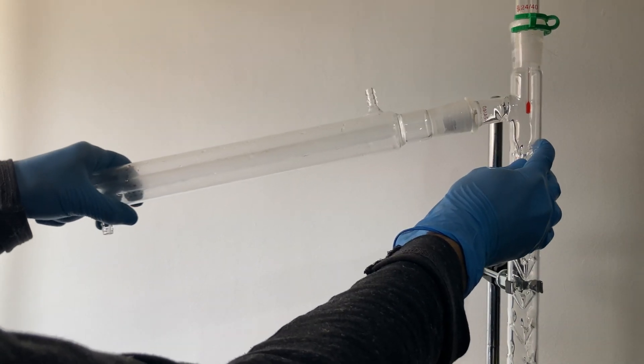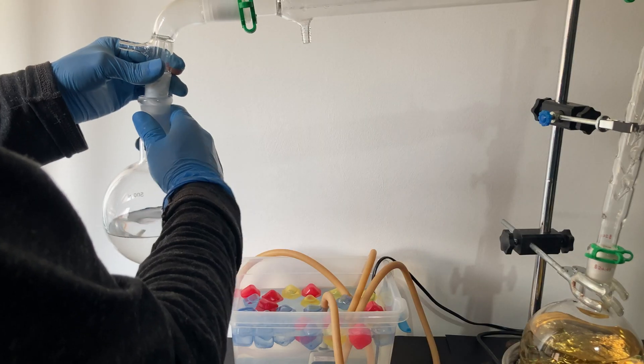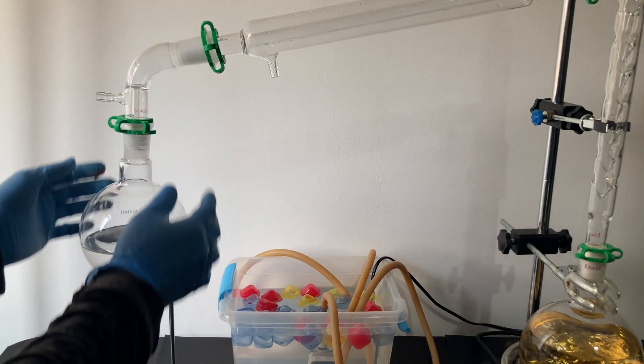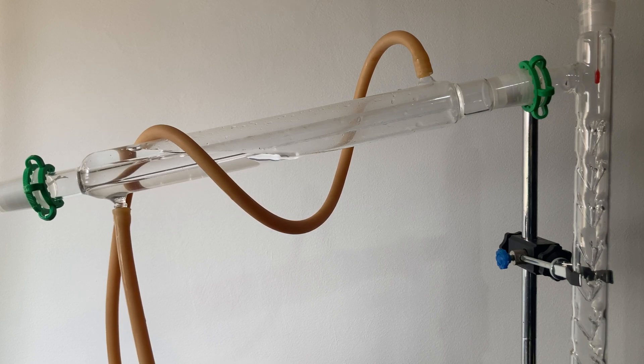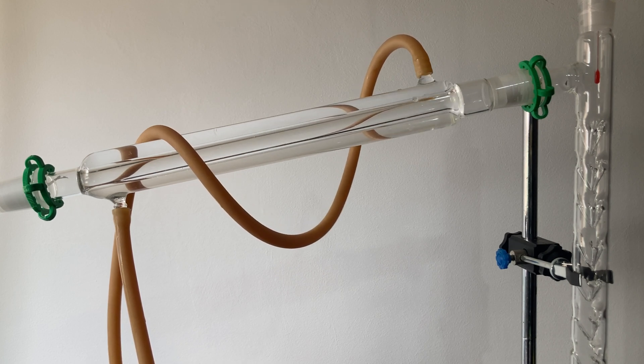Except this tower is made of glass and contains a flammable hot liquid inside it. I would not describe this as a dangerous procedure, though. Nevertheless, you need to pay attention to every detail and know what you're doing. Just take care and make sure to do it as safely as possible if you ever try it.